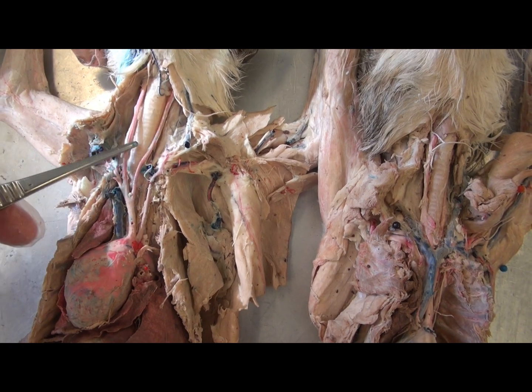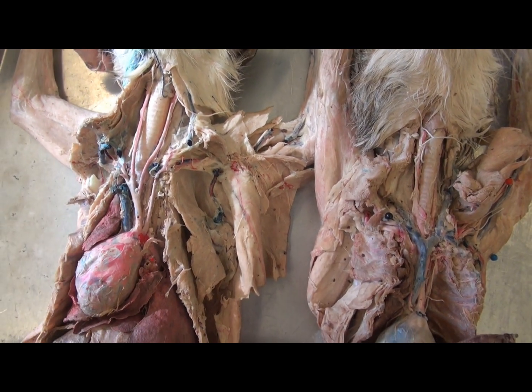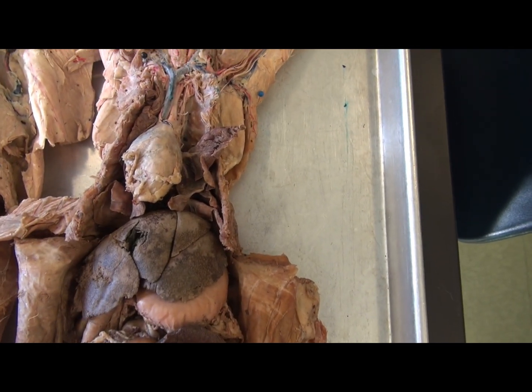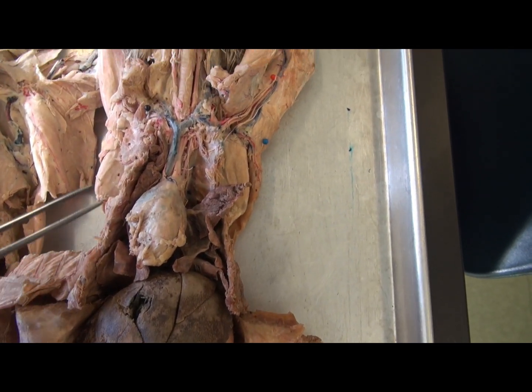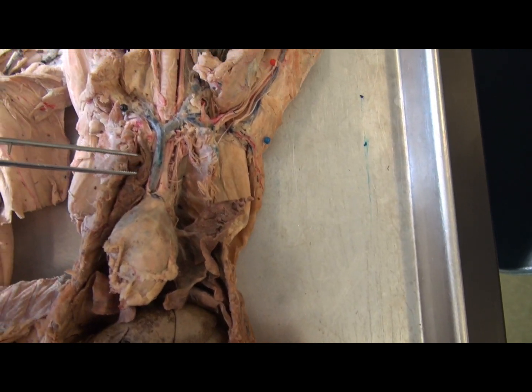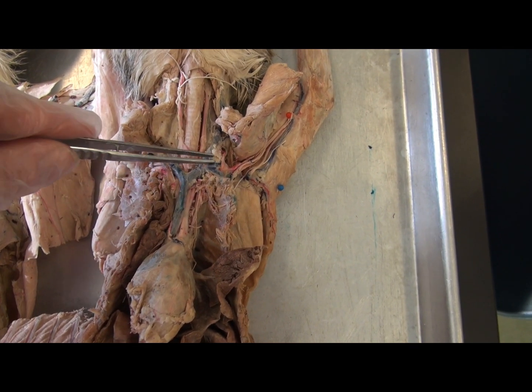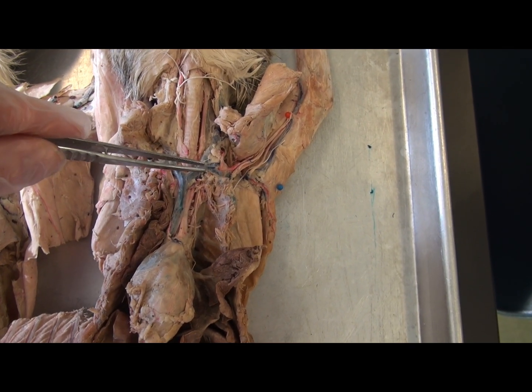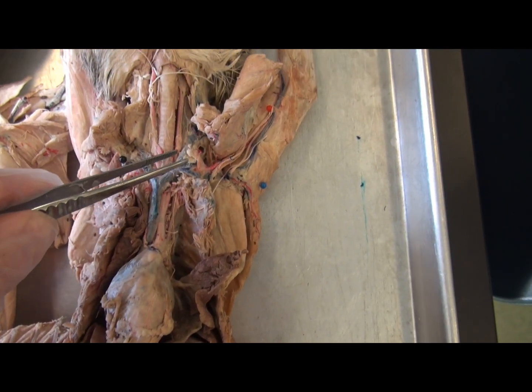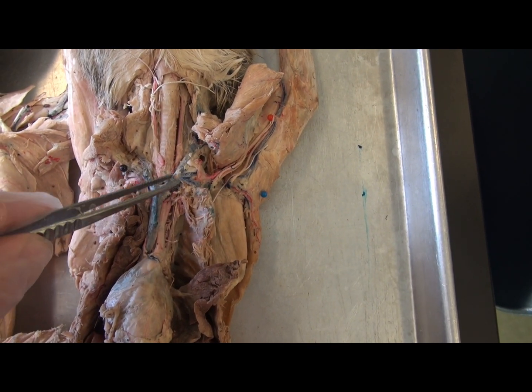Notice the prominent common carotid arteries on either side of the trachea. When the veins are present, I ask my students to try to imagine that they see the letter Y twice — a base of a Y that then has its two branches, and then each of those branches itself forms a Y.